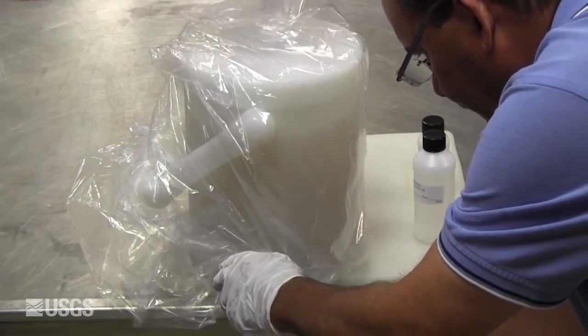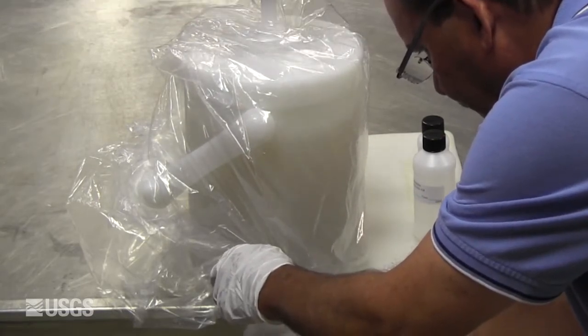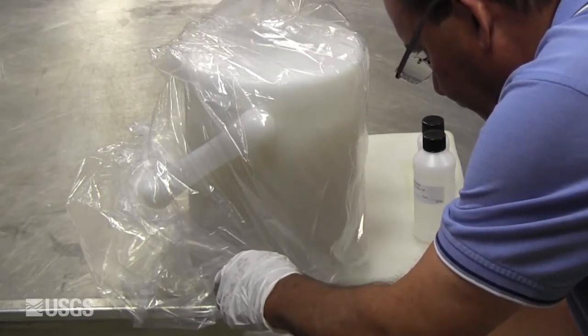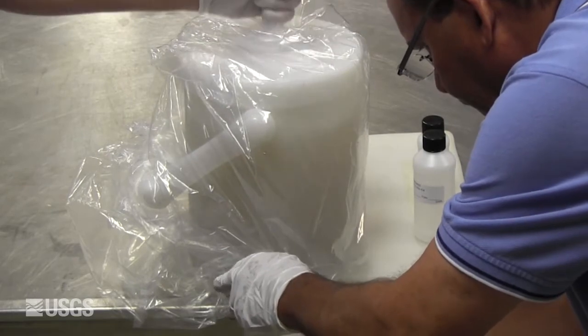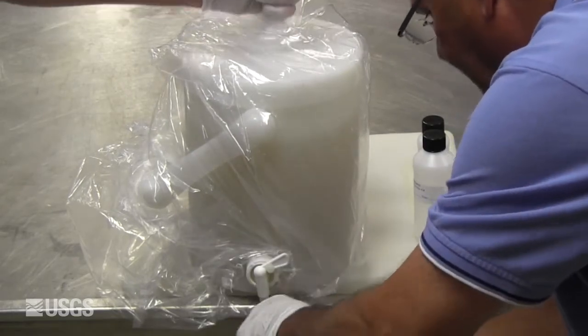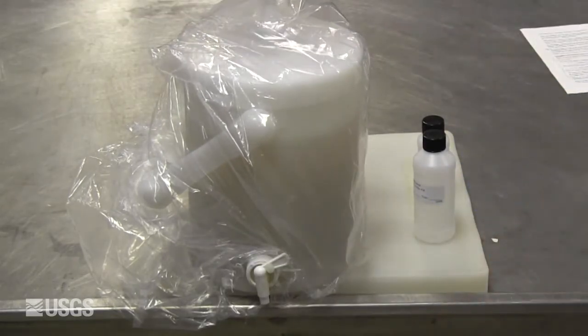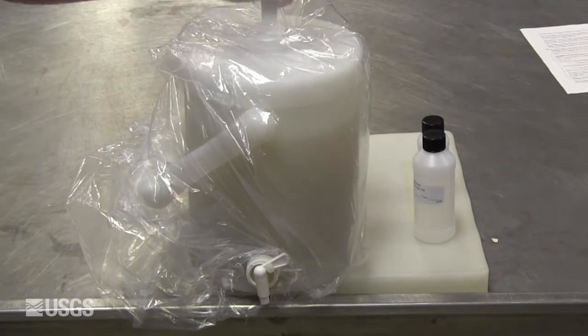Do not interrupt the churning or subsampling process. If an interruption occurs, re-establish the churning rate to remix the sample by churning 10 strokes at the proper rate before continuing.